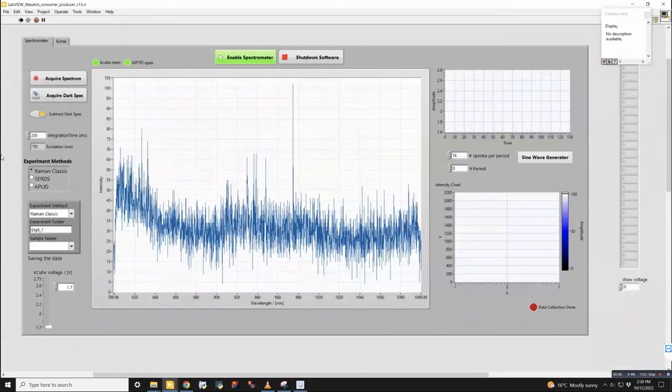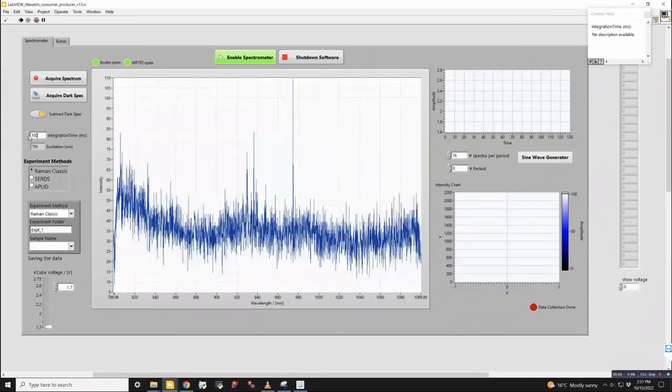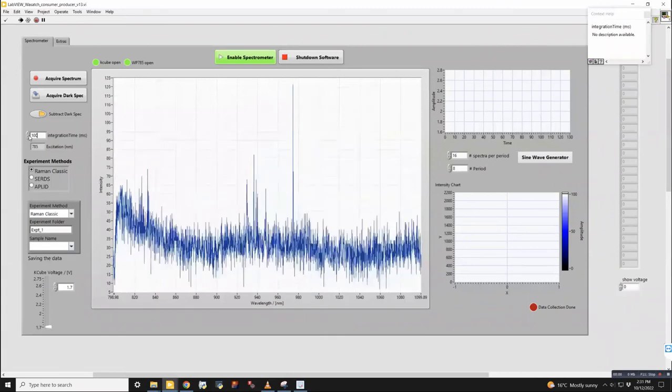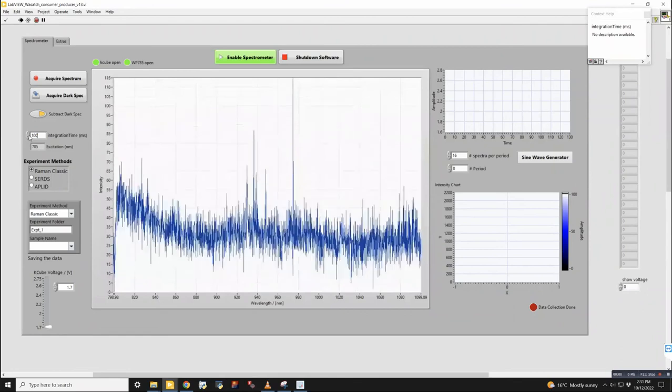So that's why you'll see if I change this back to 100, it will pause the spectrometer for a second because it's not grabbing information from it anymore. It'll change the setting, and then it will go back to collecting the data.